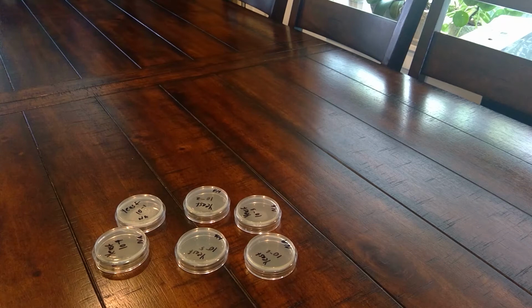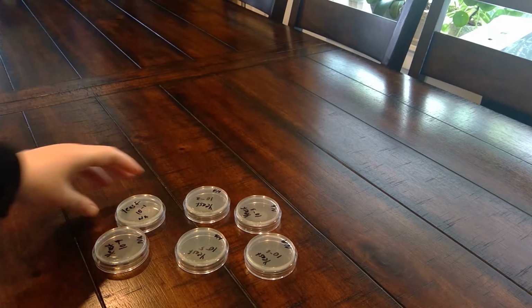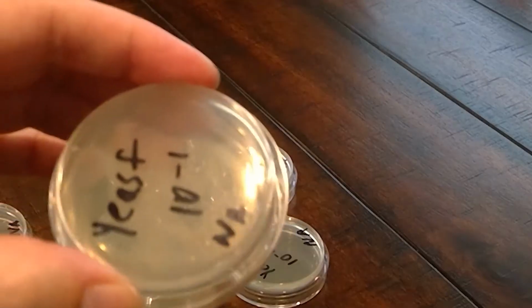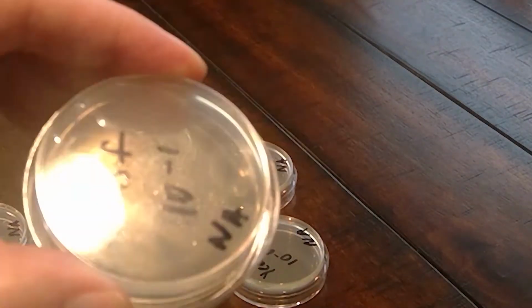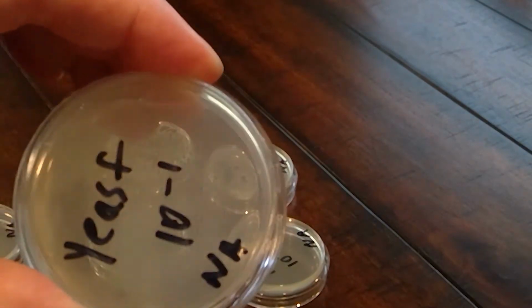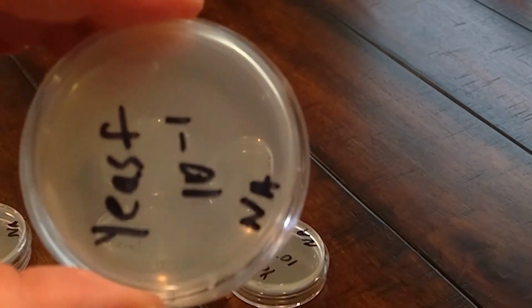All right, it's been 2 days, and so now we can go over our results for the enumeration. I'm not sure if you can see, there's some cloudiness on the first plate, but I don't see any colonies forming.